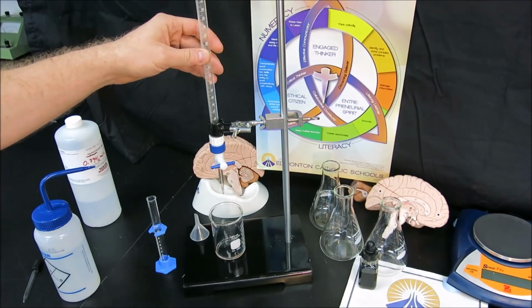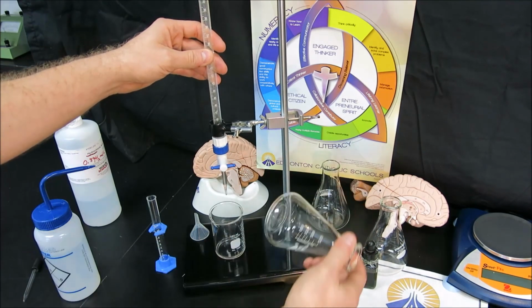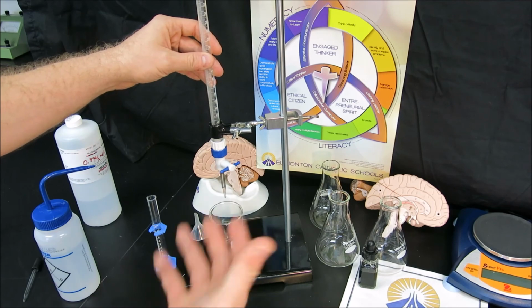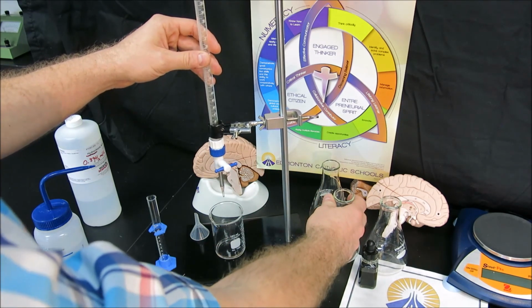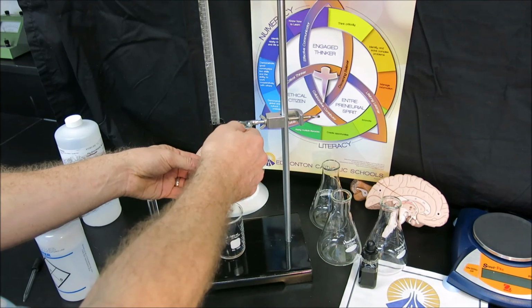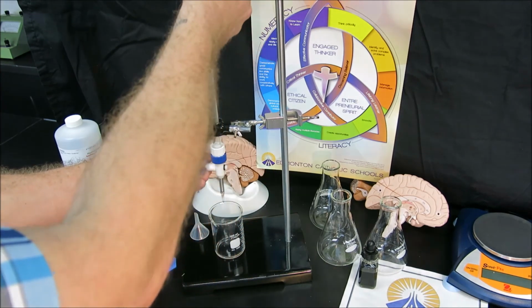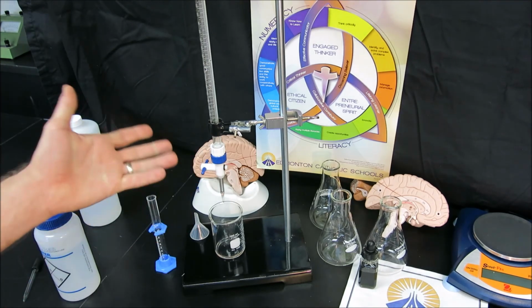One hand continuously operates the stopcock to change the flow rate, and the other is swirling the flask where the sample and the titrant are mixing. In my case, because I'm right-handed, I tend to use my right hand to swirl the flask because I have more control, and I use my left hand to operate the stopcock. When I set up my burette, I make sure to get it in the position that I want. I tighten the clamps on the burette so that it can't fall and damage the tip, and then we're ready to titrate.